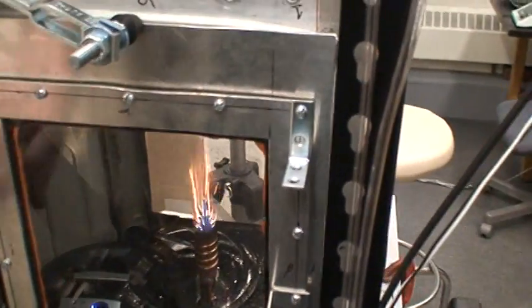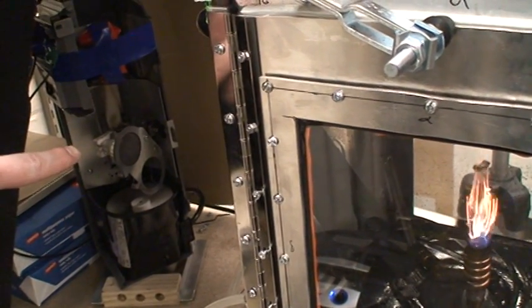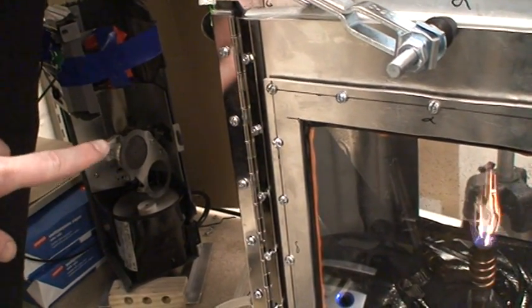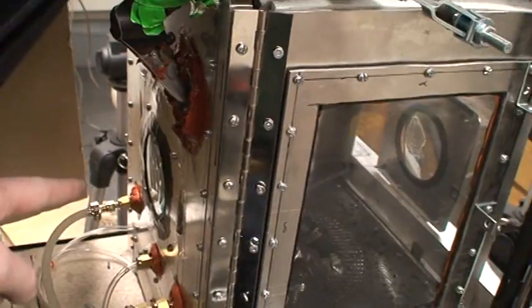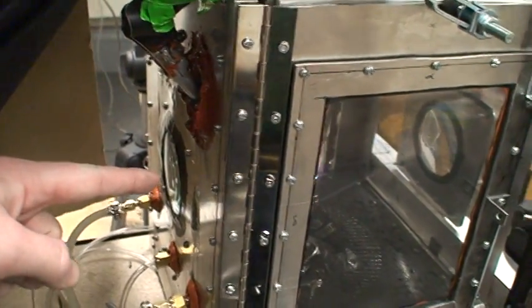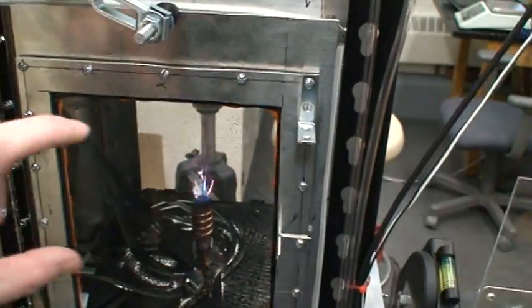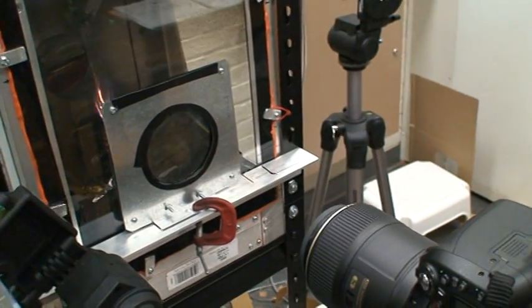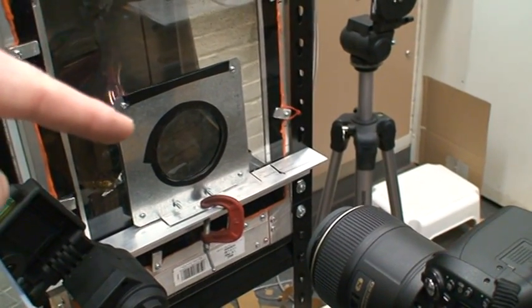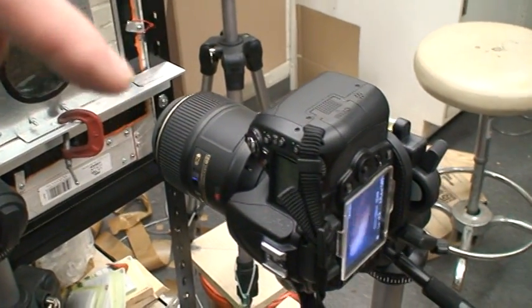So for the main Shadowgraph, we have a point source of light here, which is an old projector with a perforated plate or a pinhole over the light source. That is at the focal length of one biconvex lens. So we have a biconvex lens mounted in the side of the combustion chamber. In between, that biconvex lens is going to generate parallel light that's going to run through the test section. And then the second biconvex lens here, you actually don't have to use a second biconvex lens, but we're using a second one here to condense the light down and bring it into a macro lens on a DSLR.